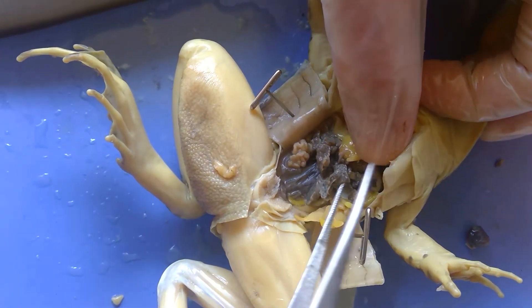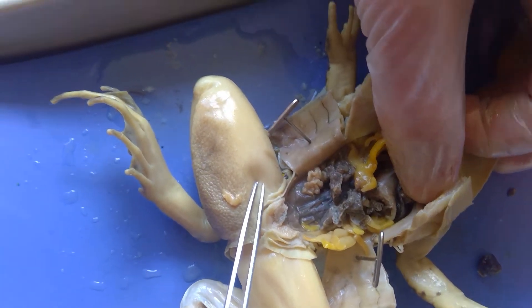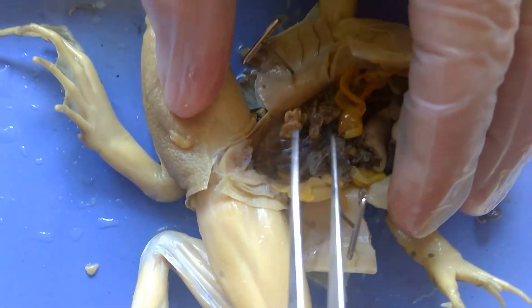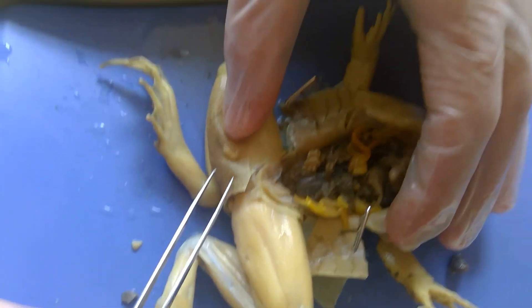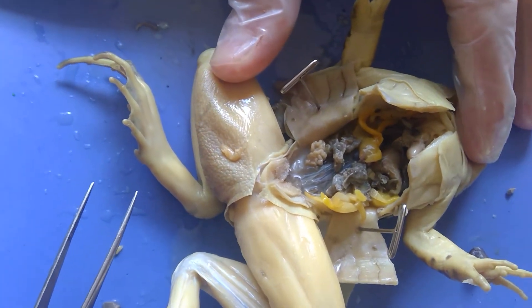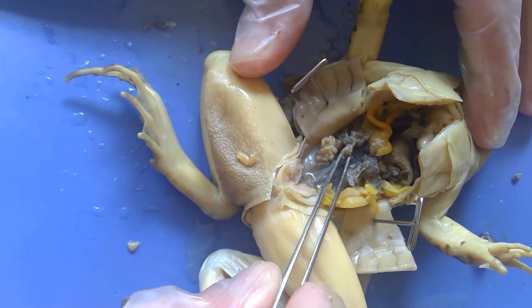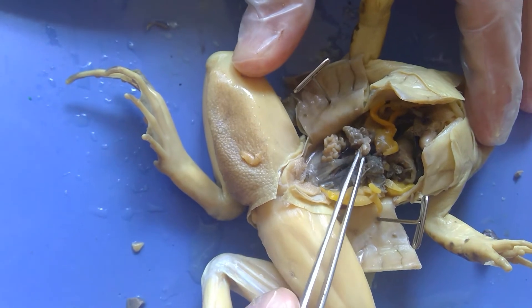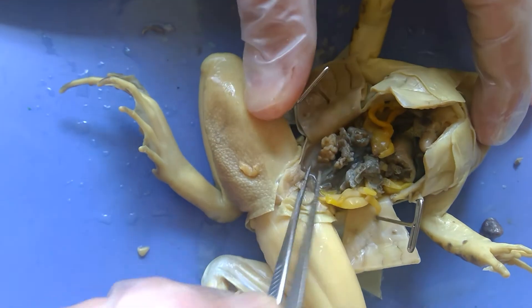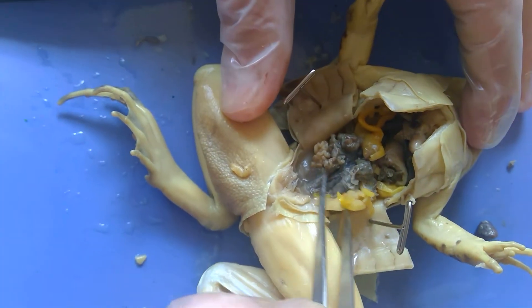In frogs, the babies grow outside of the body, so it just lays its eggs out through an opening called the cloaca — the same opening through which poop and urine exit. So this is a female: this is the ovary, this is the oviduct, and then attached to that would be the bladder.